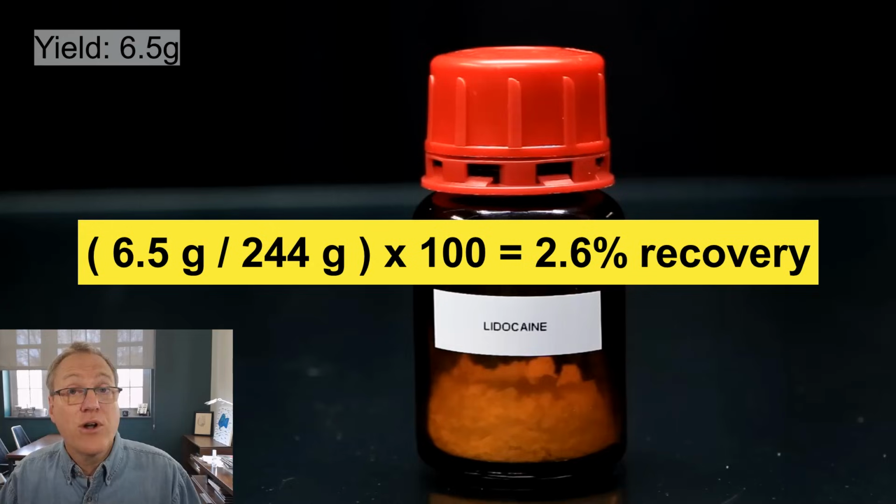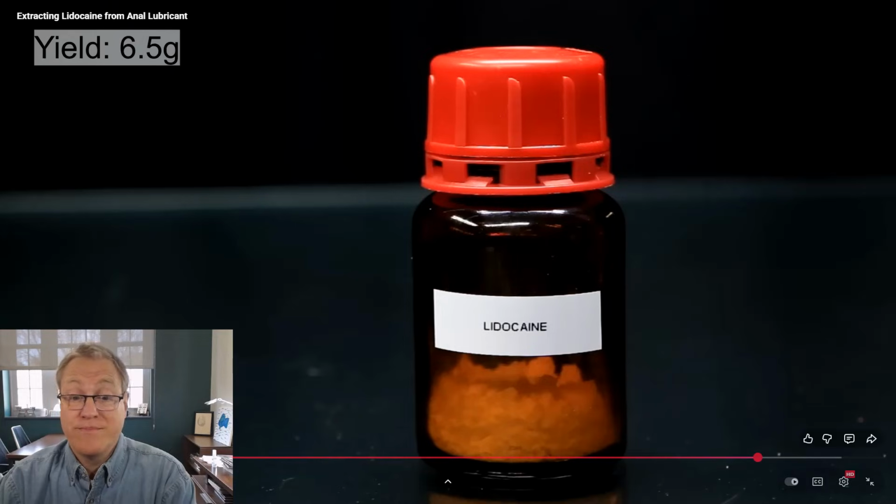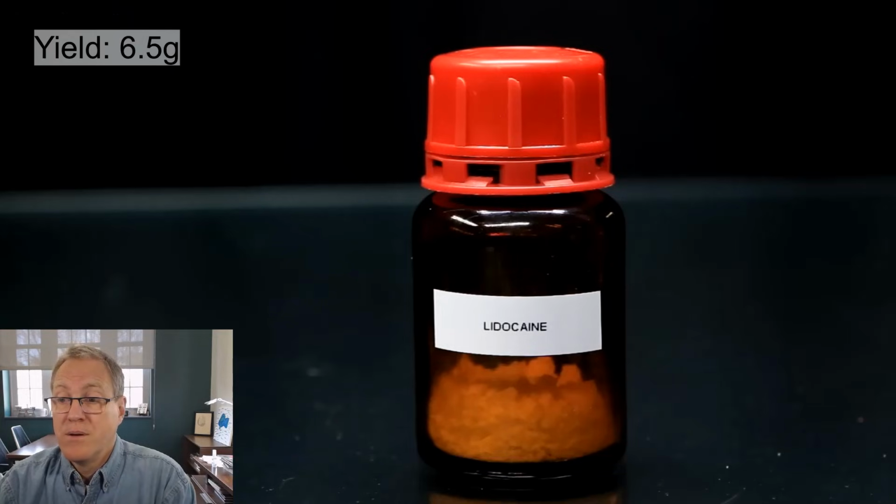Now, presumably it started at 5%. So he has lost some material, but I would say getting about half the lidocaine out of that soup, that's pretty good. Anyway, 6.5 grams is more than enough for me.